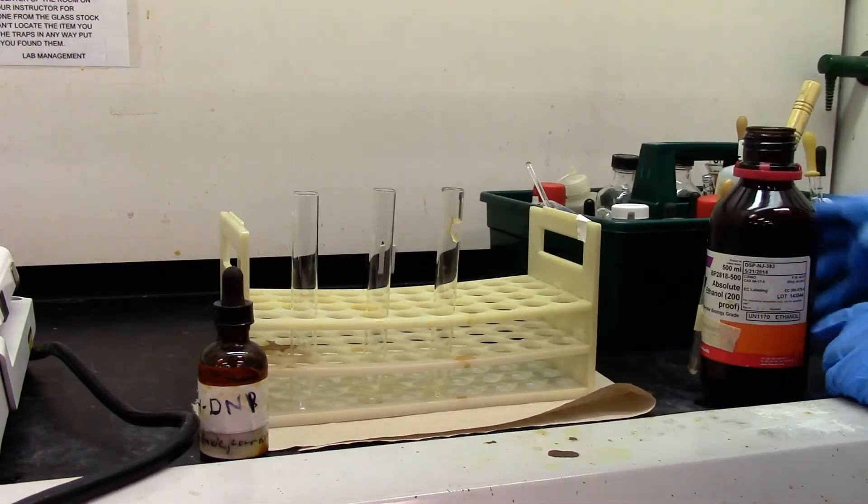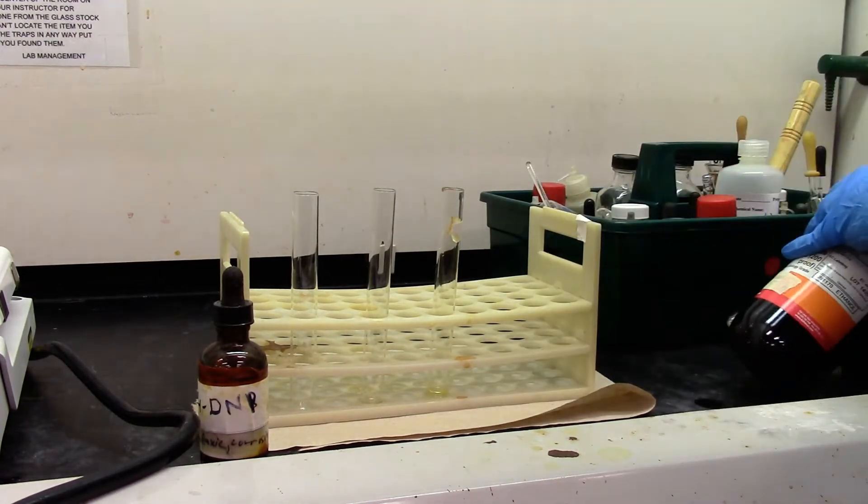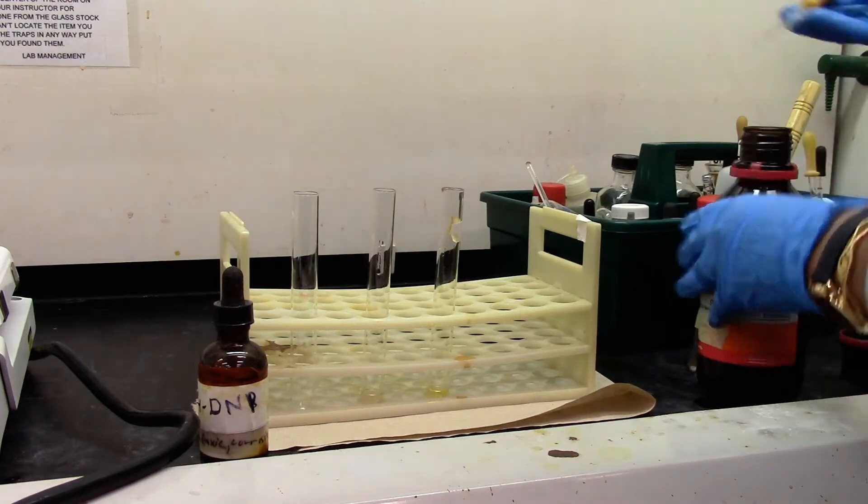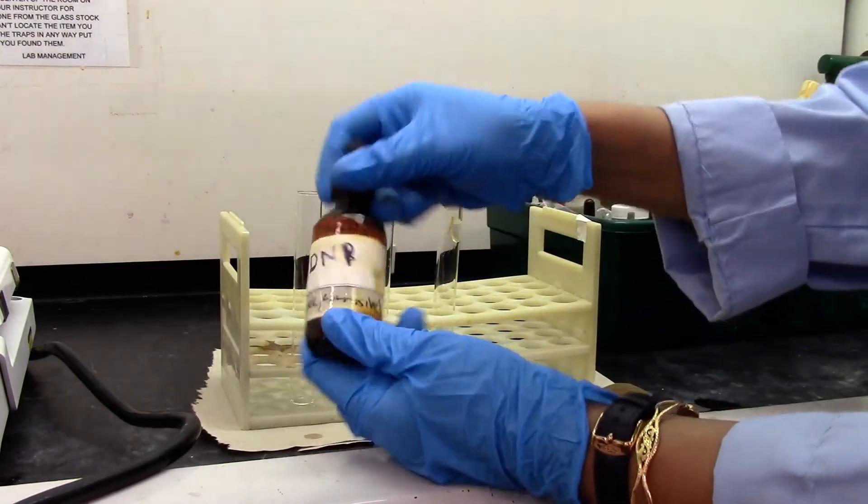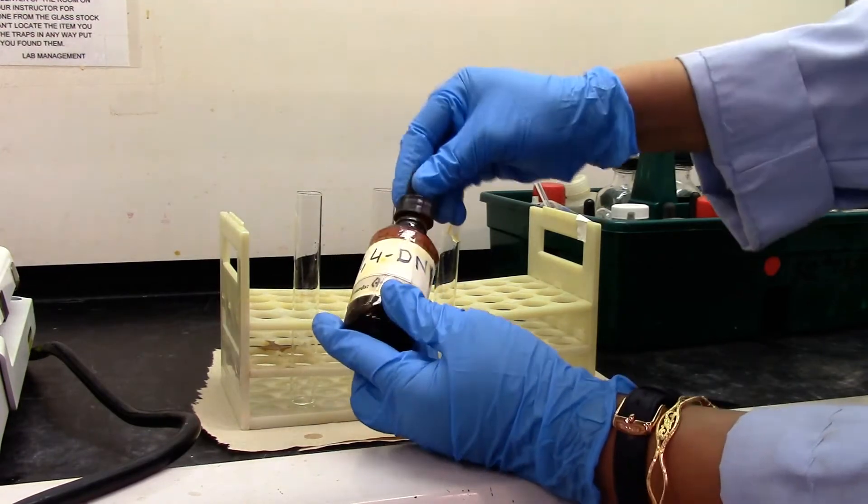I'll be using some ethanol as solvent. I'm going to add a few drops of the reagent, 2,4-DNP, in each of the solutions.